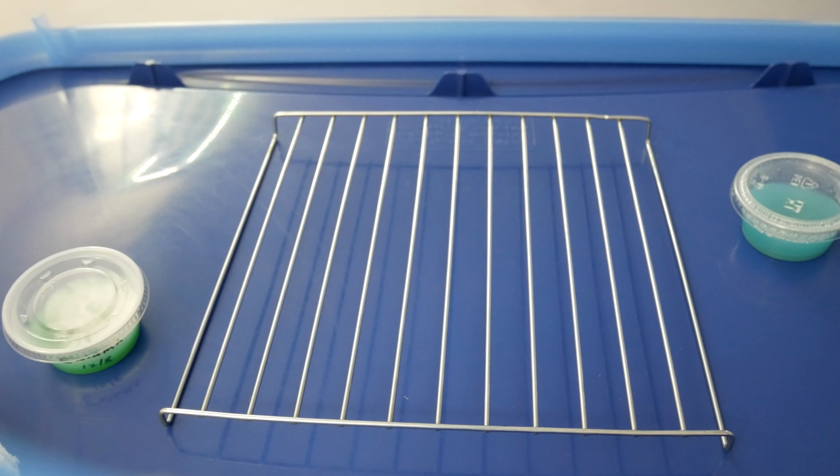And when you're doing this, we're pretty much skipping the process of germinating spores, and we're going straight to having the mycelium colonize the grains. So it's going to speed up your jar colonization by a week or two compared to shooting spores directly into them.